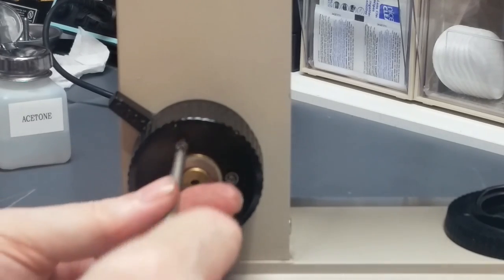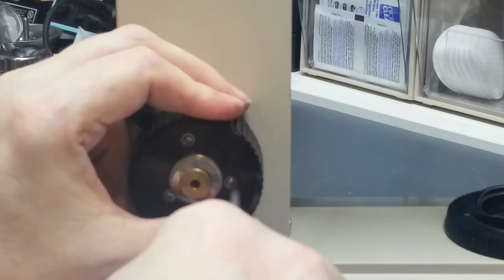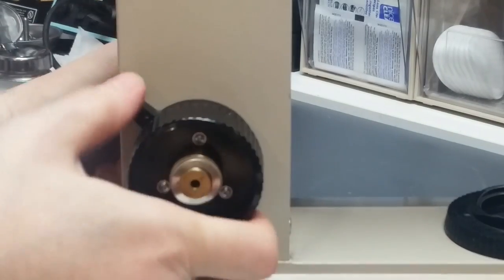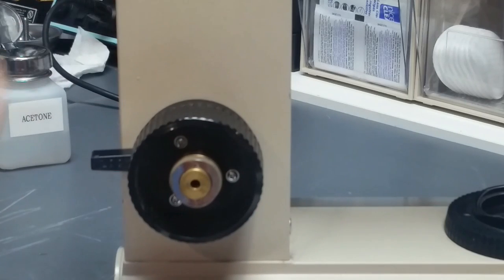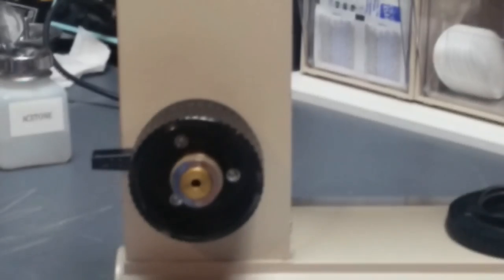The last one. Okay, and let's snug them down. Don't go too hard. You don't want to crack the knob, but you want to snug them down. Okay. All we need to do is clean off the fine focus shaft, reinstall the shaft and the knobs, and we'll be ready to go.